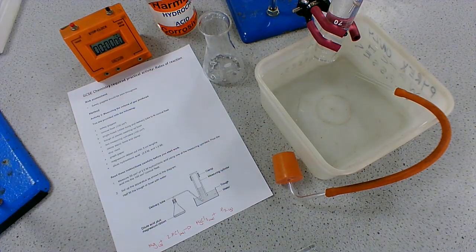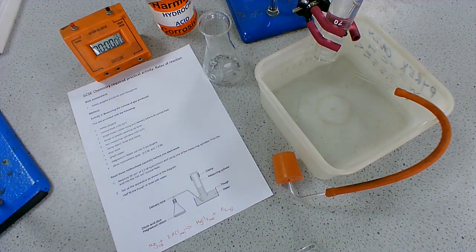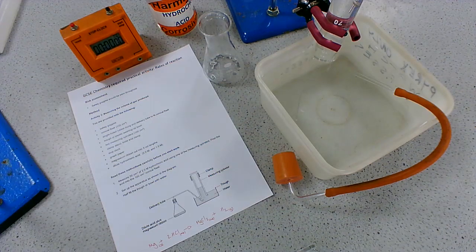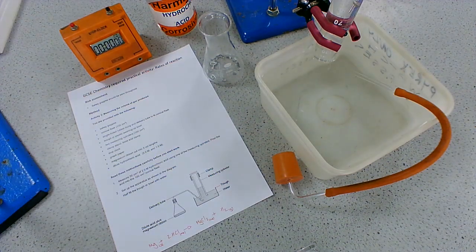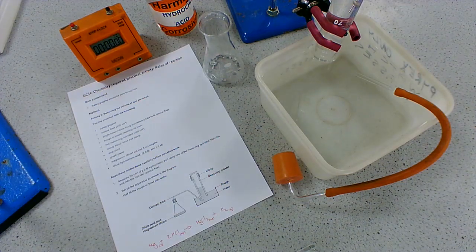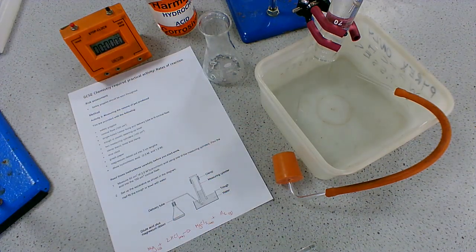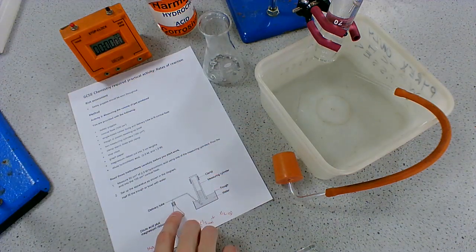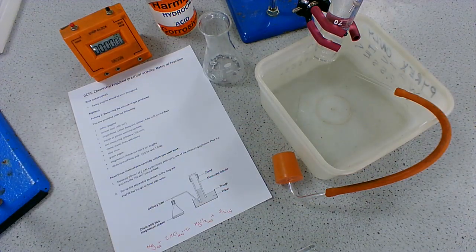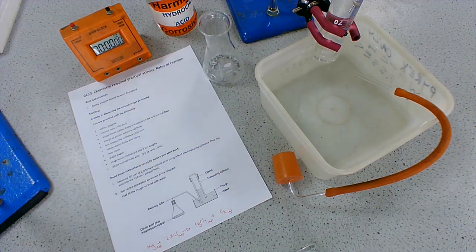In this reaction, we are going to look at the gas being produced. We're going to collect the gas being produced over time and use that to determine the effect of changing concentration on the rate. I'm going to run through the method once, and obviously you would just repeat it with the exact same measurements, keeping all the control variables the same, just varying the concentration of the hydrochloric acid. We have our conical flask, and it's important when dealing with volumes of gases that we use a vessel that allows us to put a bung in the top. If I was using a beaker, I wouldn't be able to prevent the gas from being lost. So use a conical flask, boiling tube, or test tube.